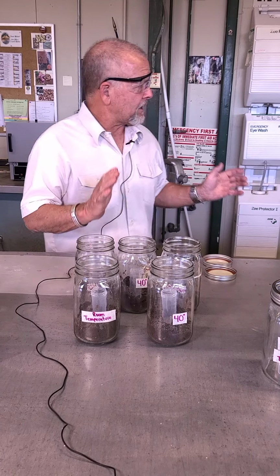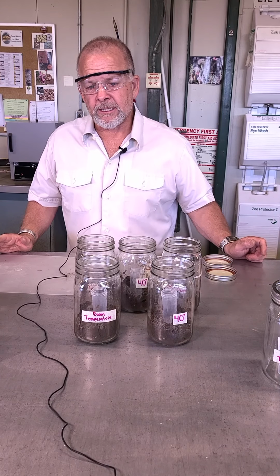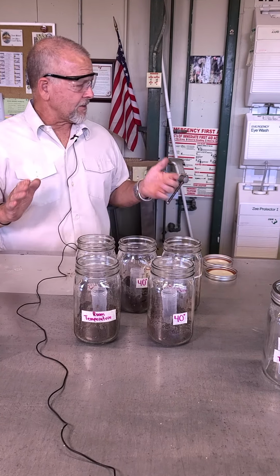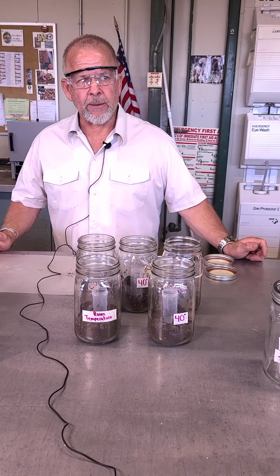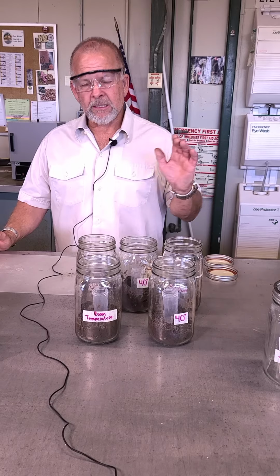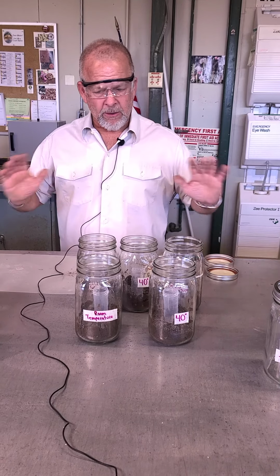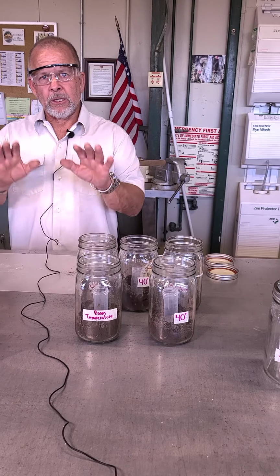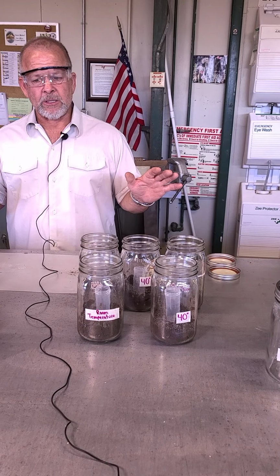And we're still trying to get our 40 degrees Celsius, or 104, 105 degrees Fahrenheit, dialed in on our ovens. It's kind of a low temperature, but we'll figure it out. We'll get whatever that temperature is, and then we'll get back to you guys with what that is. So we actually have all the numbers, and everything is going to be consistent. So I'm going to leave it at that. I've kind of explained what's going on.